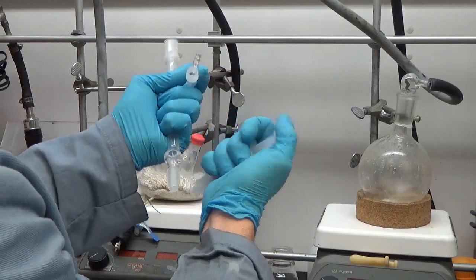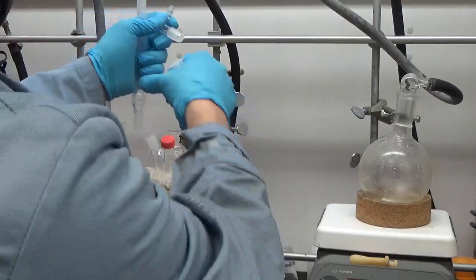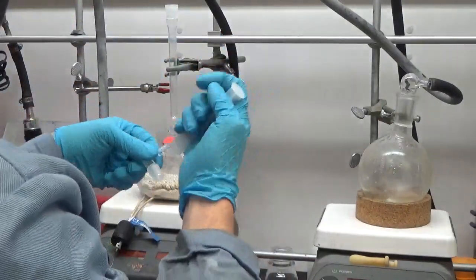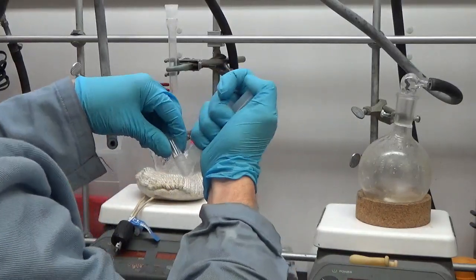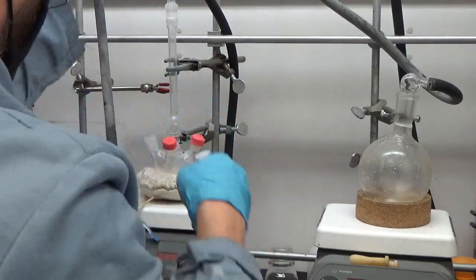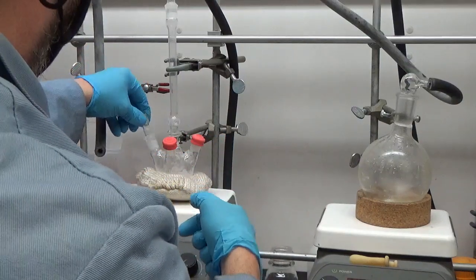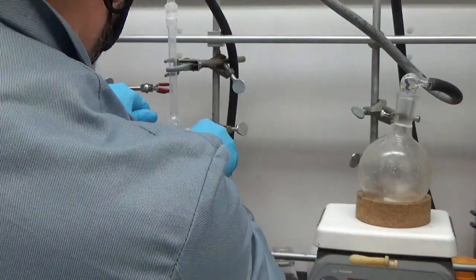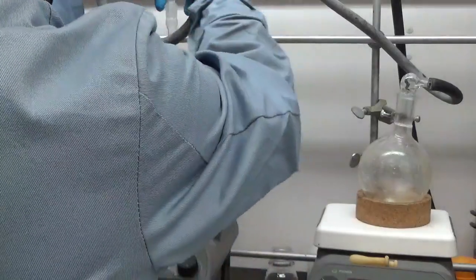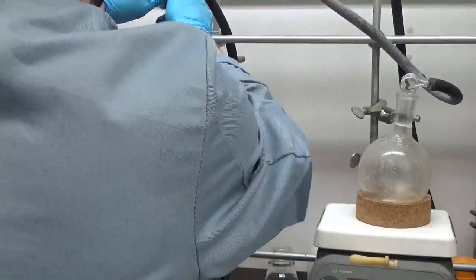The reason this whole procedure is a little extra complicated is because I need to know how much cadmium and phosphonic acid to add. Here you see me connecting it to the Schlenk line. What I do is degas it, get all the water out, and then I'm going to heat it up to 250°C and back down, which forces the cadmium acetate to react with the phosphonic acid to form cadmium phosphonate. You have to do that above 200 degrees - I usually do 240°C for just a few minutes - and then I cool it back down and do more vacuum. You have to do that before you add the QDs to the pot.